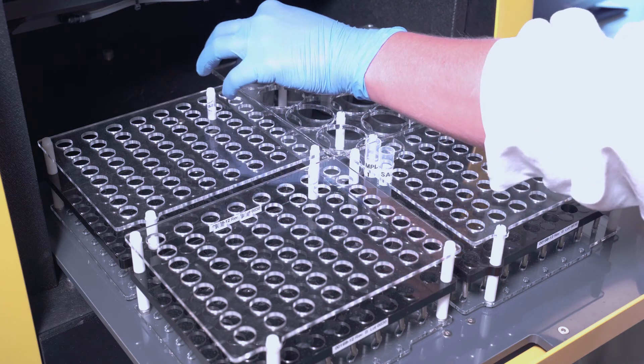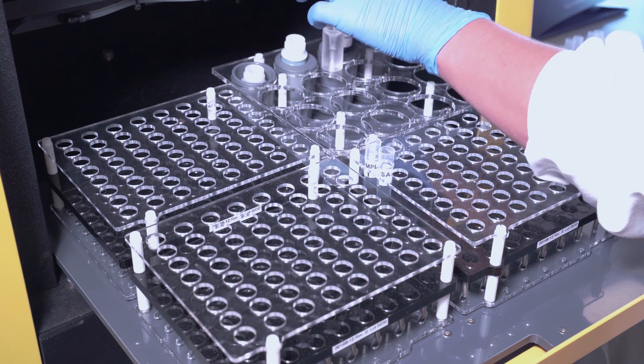Add the reagents and the calibration curve in the correct holes, following the program instructions.